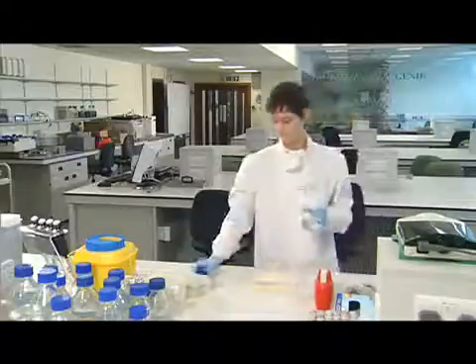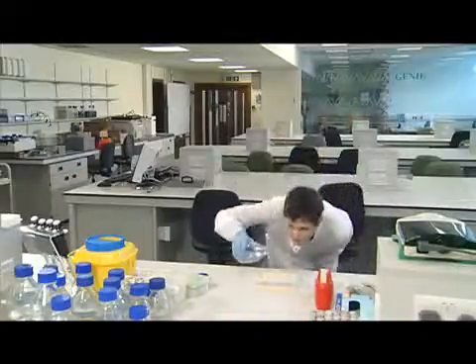Once you've made sure that the gel tray is level and you've inserted the comb, slowly pour the gel solution into the gel tray.